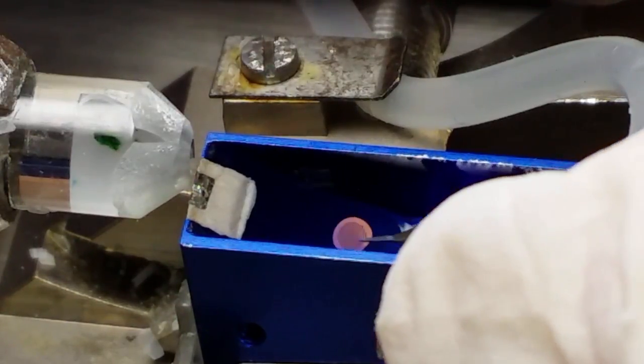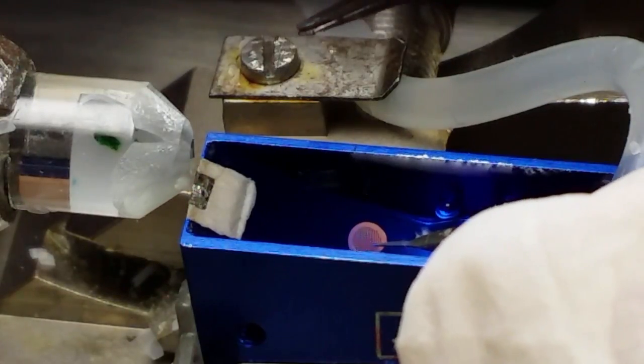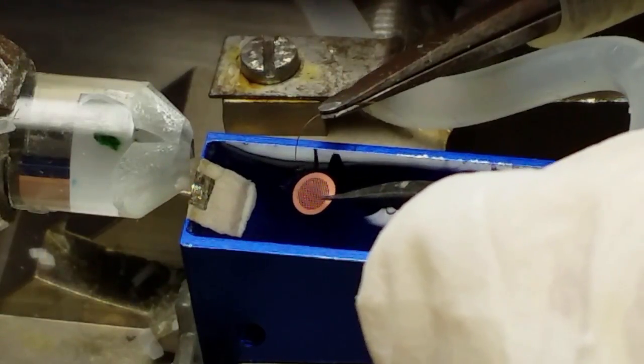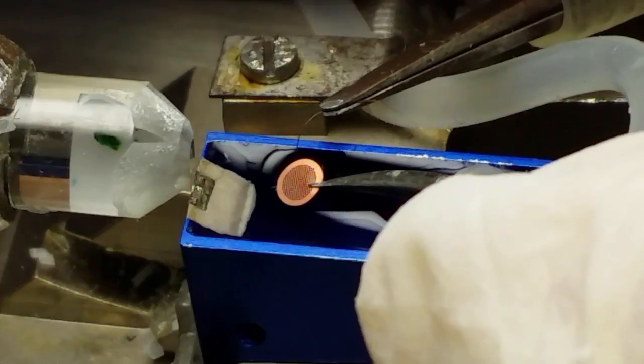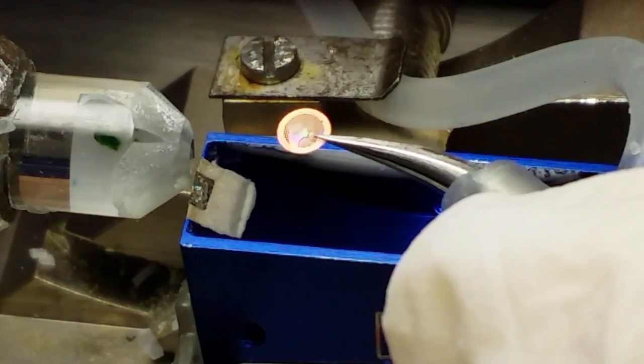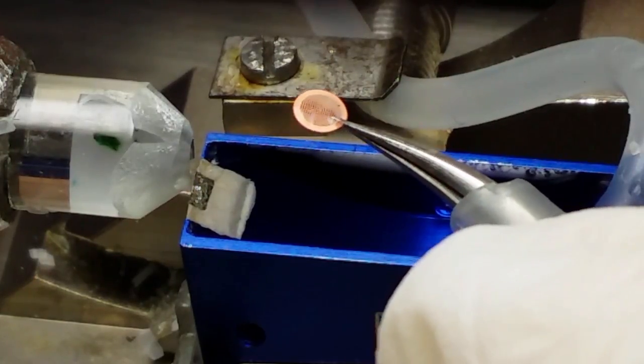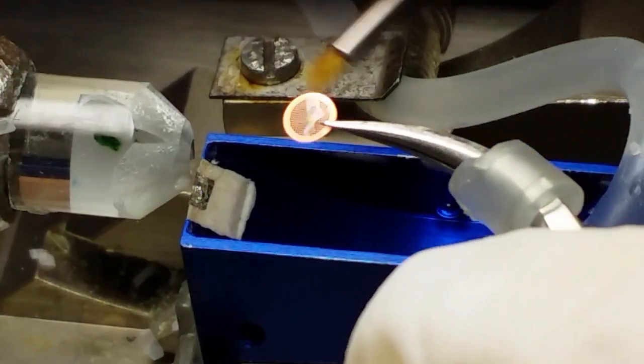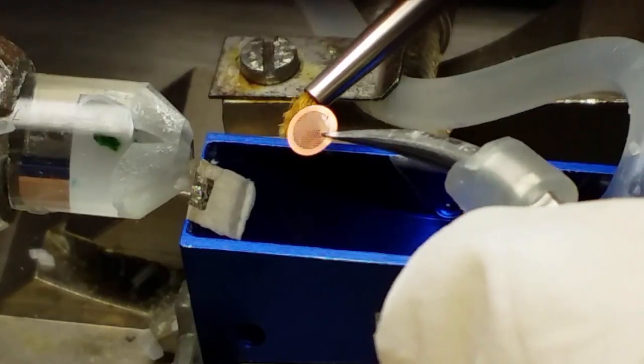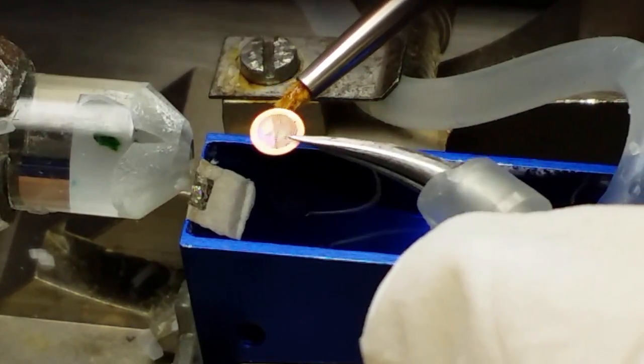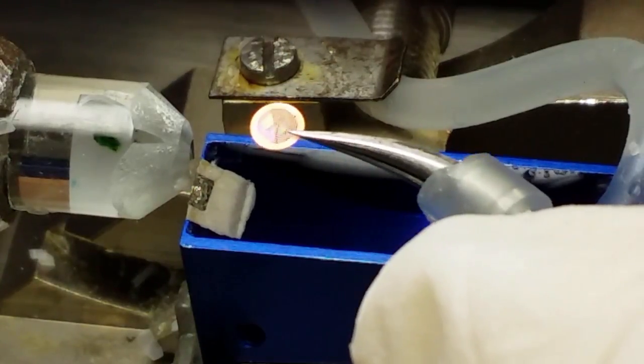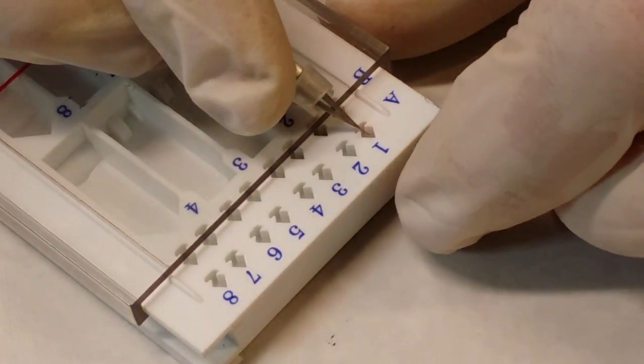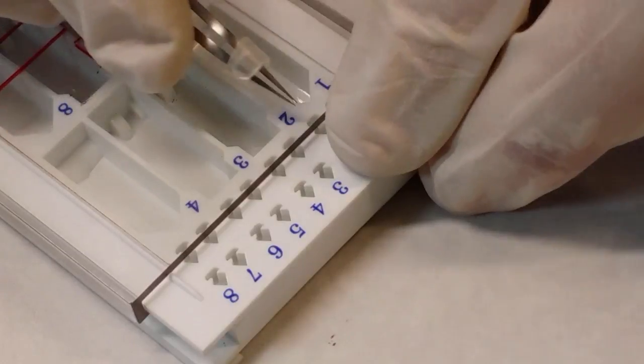I take the grid with the left hand. Put it beneath the water surface. Take the eyelash with the other tweezers. Force the slice on top of the grid. And then gently drag it up from the surface. That's it. I can try to take away a little of the water by the brush. Here we have the piece. So now either you heat up and dry the sample on a heating plate. Or let it dry in air. Then you put it in a storage box.